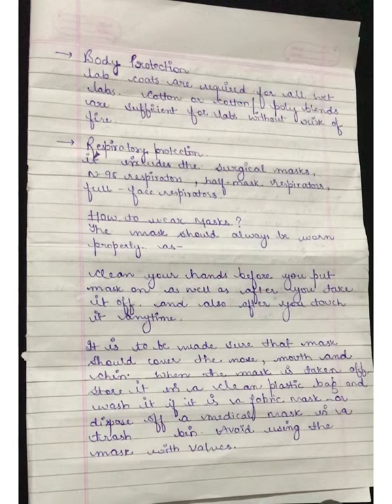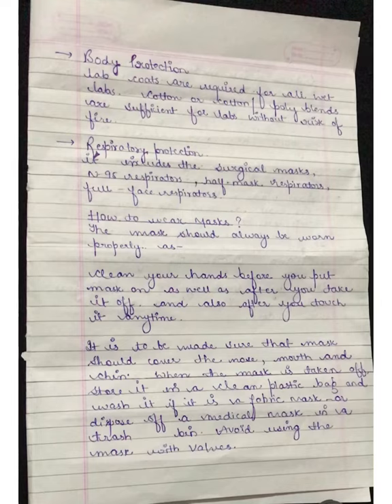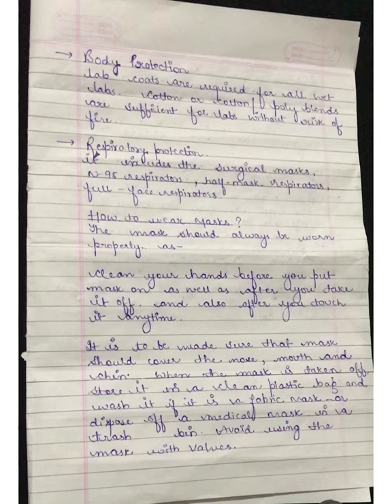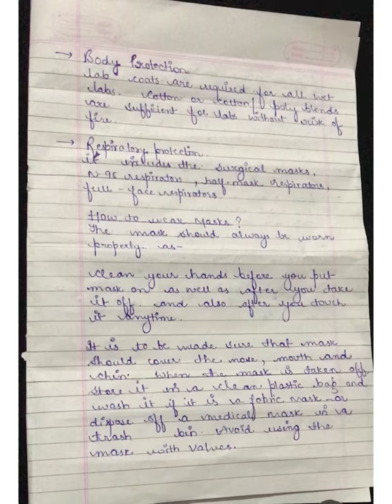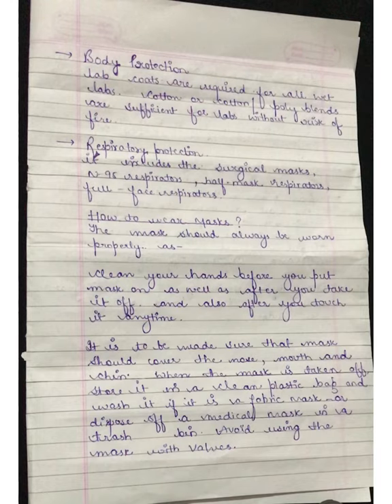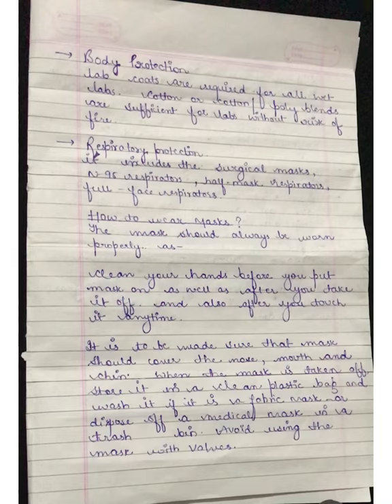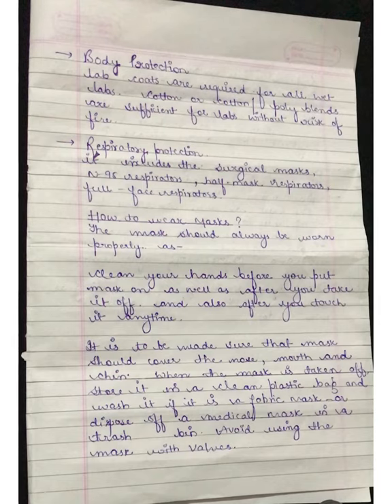Now the next part of the practical is how to wear masks. First of all, clean your hands before you put the mask on, as well as after you take it off, and also after you touch it at any time. If we have to touch our masks, we have to wash our hands. We have to keep our hands clean, because our hands are the most common entry point for microbes into our body.